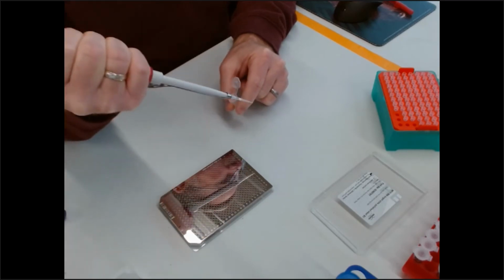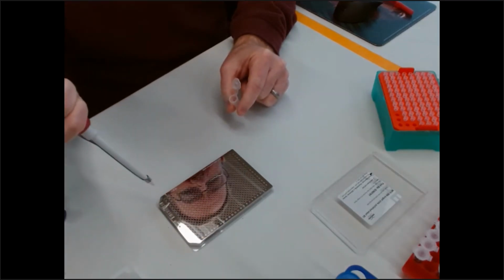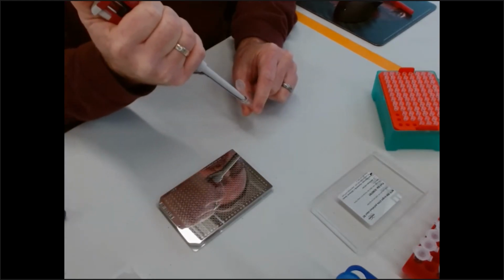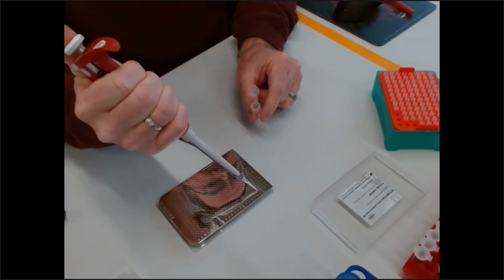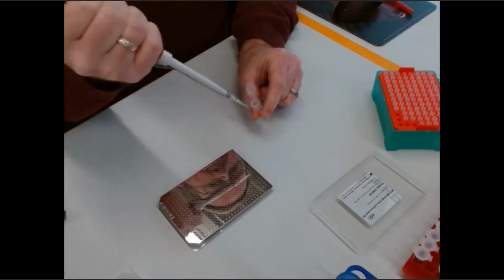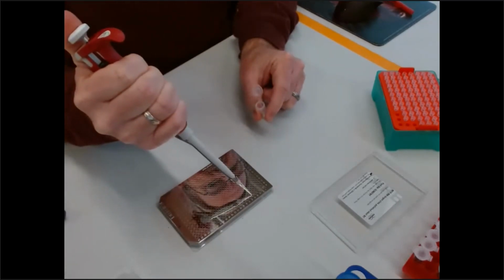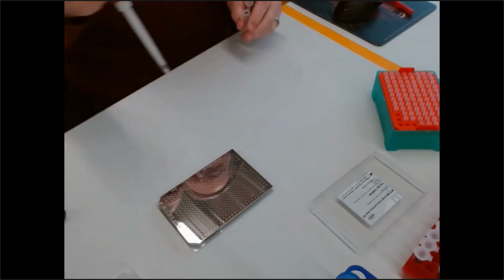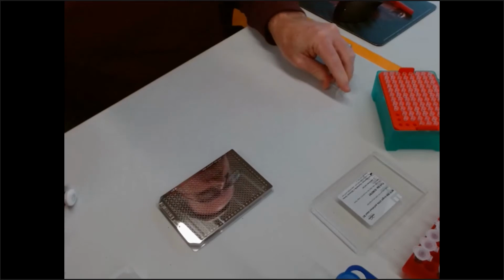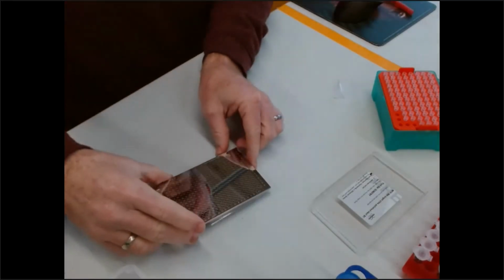And as Pierre mentioned, I have 384 different options here. So we can put a lot of samples on these targets, and we can do a lot of high throughput analysis. So I'm just going to lay this down in 3 different wells. And what you're going to see as we're talking here is that the samples are actually drying on the well.